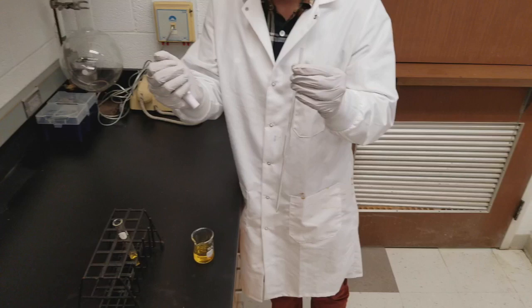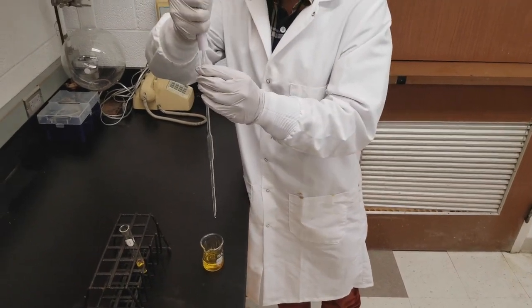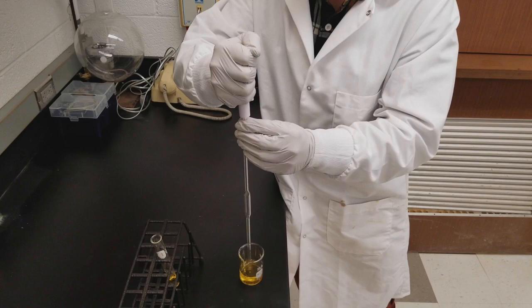This video details how to use a volumetric pipette. Begin with the pipette in one hand, holding it up toward the top. Your pipette bulb will be in the other hand. Compress it and then gently place it on top of the pipette.